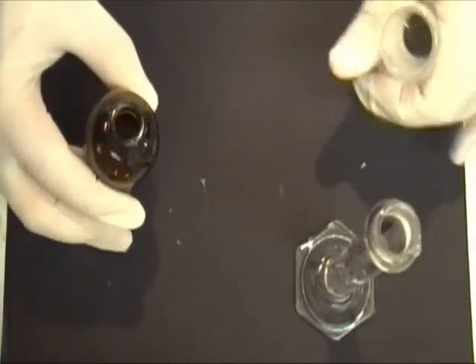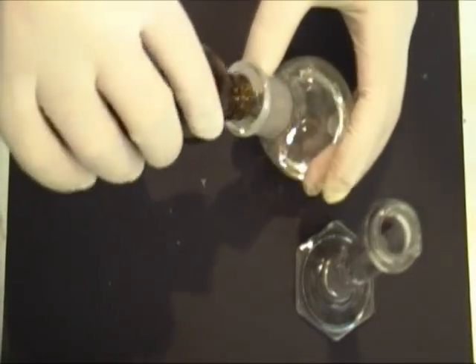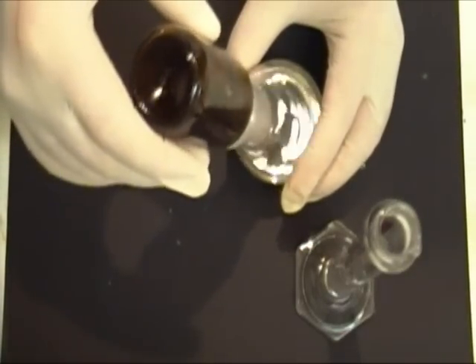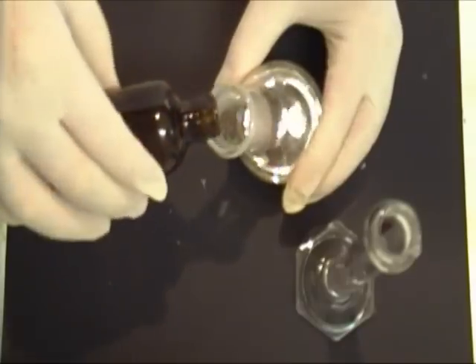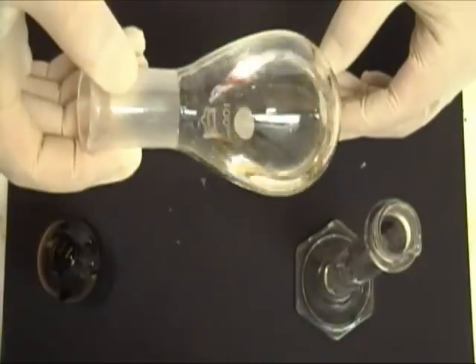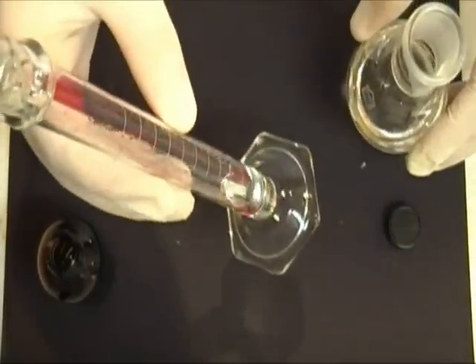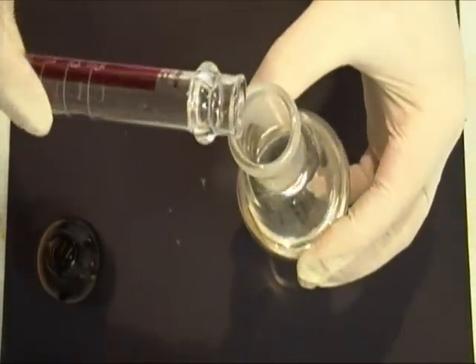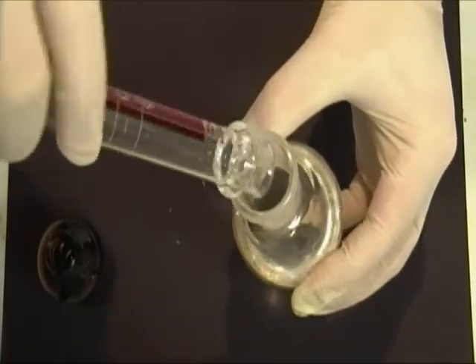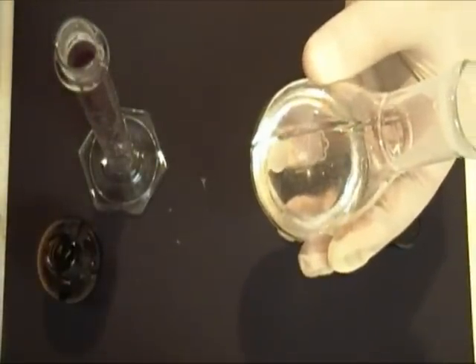You can start by taking your cyclohexanol and pouring it into your flask. Go ahead and note the aroma of cyclohexanol, because cyclohexene smells nothing like it — they're like night and day, and that can come in useful later. You can also notice that this has a very high viscosity compared to other alcohols and even water. Now pour in your phosphoric acid.